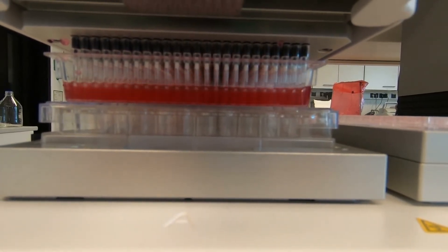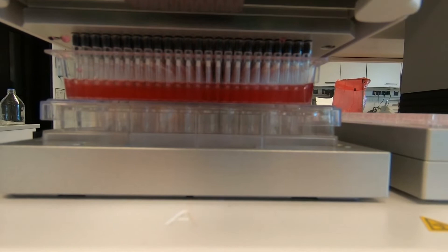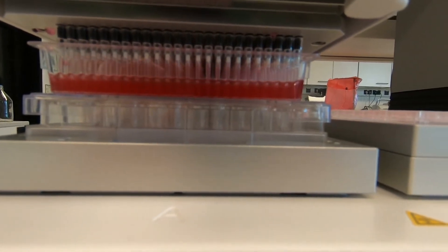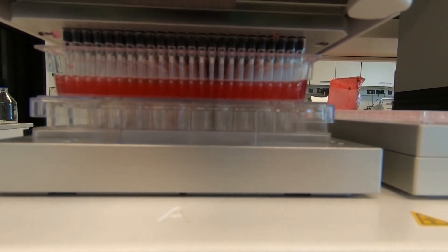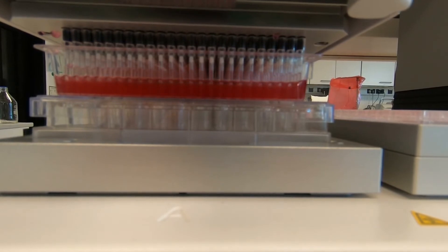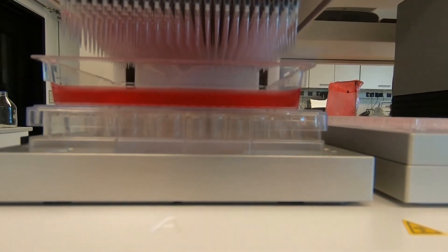What does this video show? This video shows the seeding of 3T3 mouse fibroblasts into a 1536-well plate which has been pre-coated with our protein and cell-repellent biofloat coating solution.